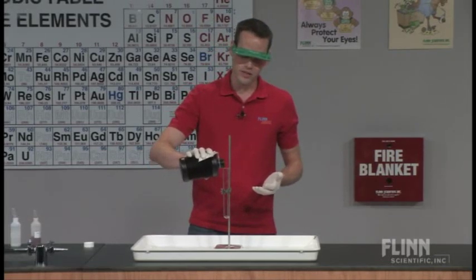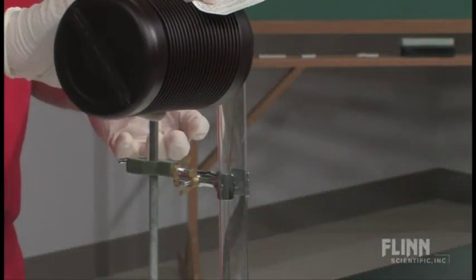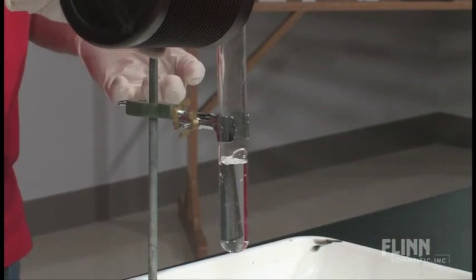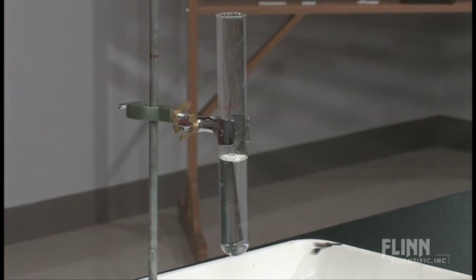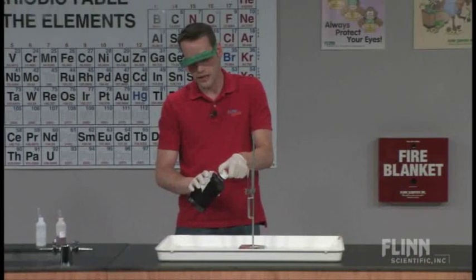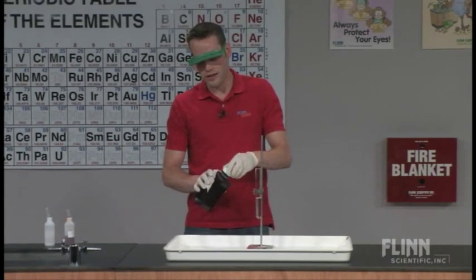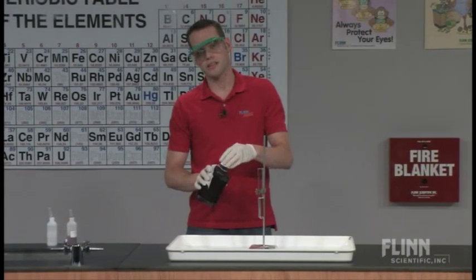I'm going to pour some 30% hydrogen peroxide into my test tube. You can measure it out to 20 milliliters — I tend to just eyeball it and make sure that I'm using enough to get the reaction that I want. You'll also definitely want a large chemical splash tray for doing this demonstration.